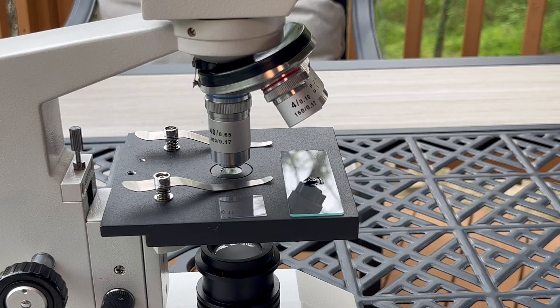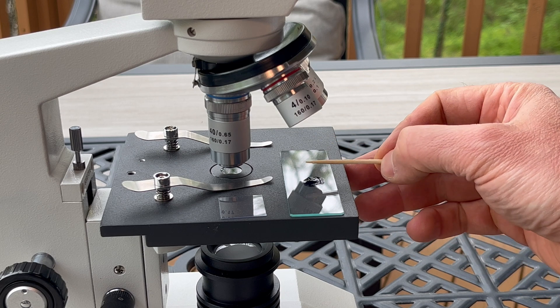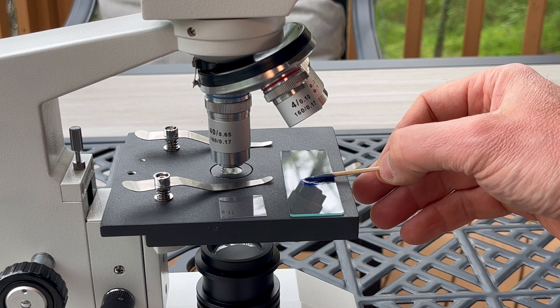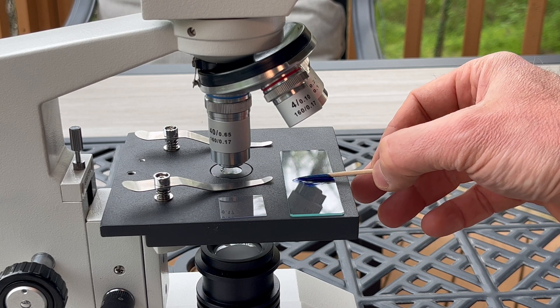Next, I'll need to get the sample of human cheek cells from the inside of my own mouth. I do this by gently rubbing the end of a toothpick against the inside of my cheek. Then I will transfer those cells into the methylene blue dye by rolling the end of the toothpick in the dye.